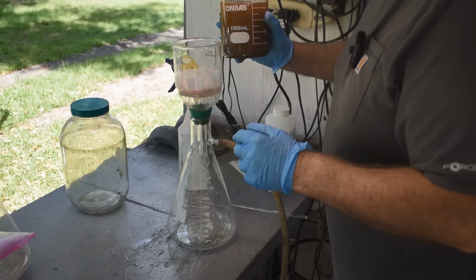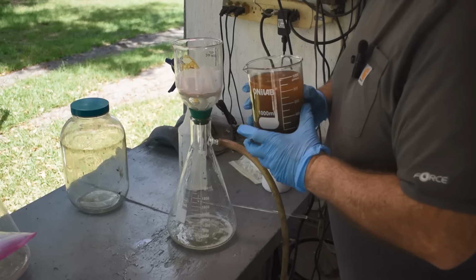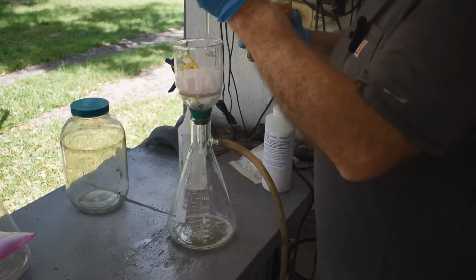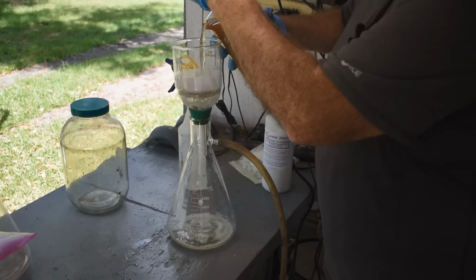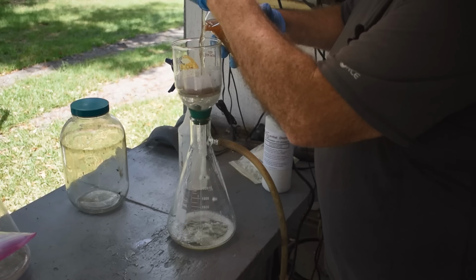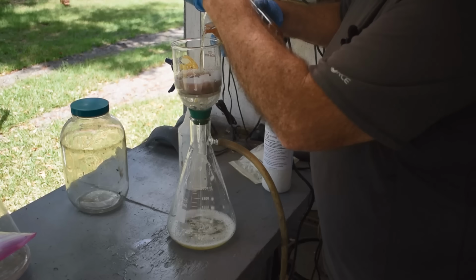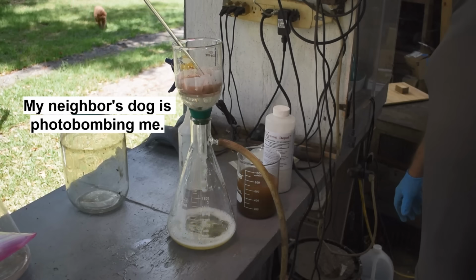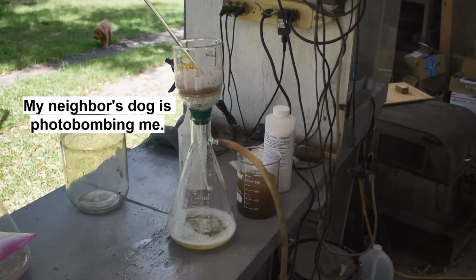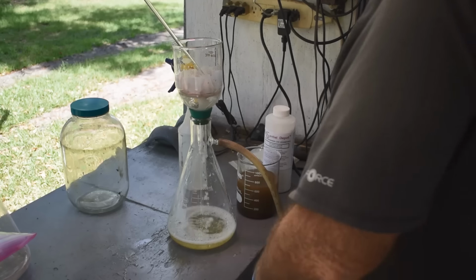That thunder seems to be getting louder. Yeah, try something here. There we go. I'm not expecting there to be anything of value in the liquid other than reusable leach, which could be reconstituted and reused again. All of the values are down in the solids down there. So that's what I'm trying to capture.